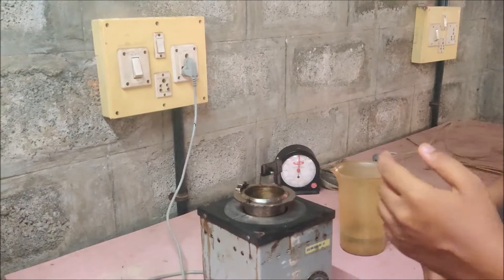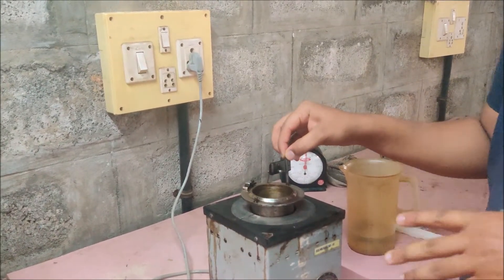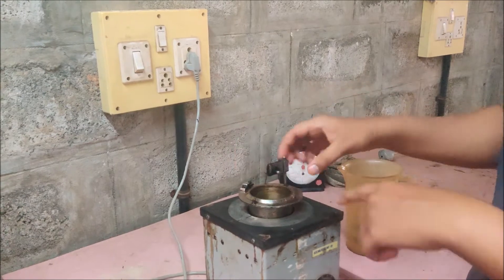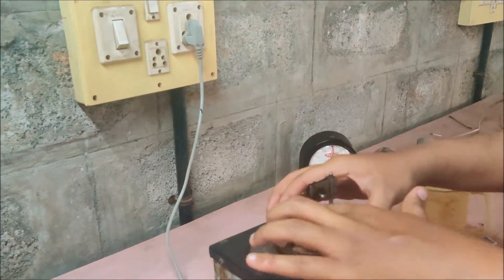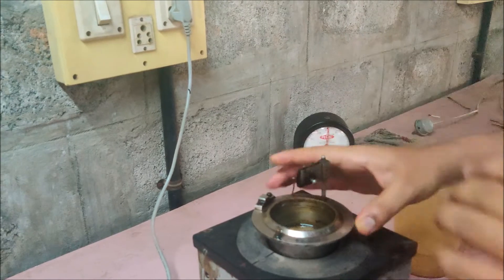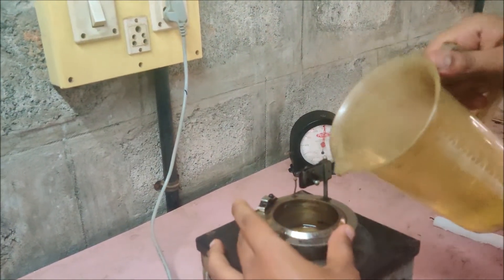Before you use the apparatus, make sure that the apparatus is completely clean. You can see the groove that is given over here. You have to pour the oil sample until that groove, exactly to that groove. So let's pour the given oil sample.